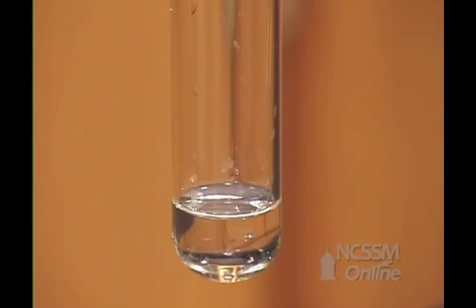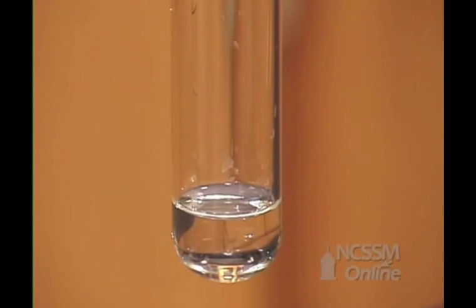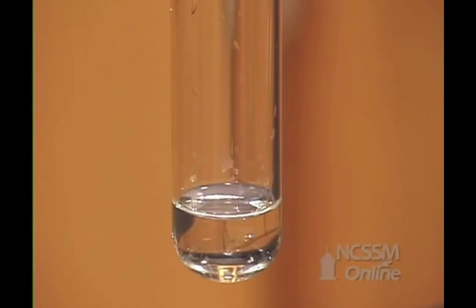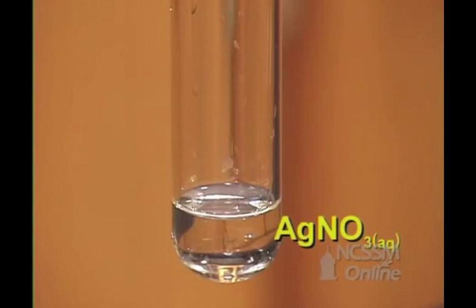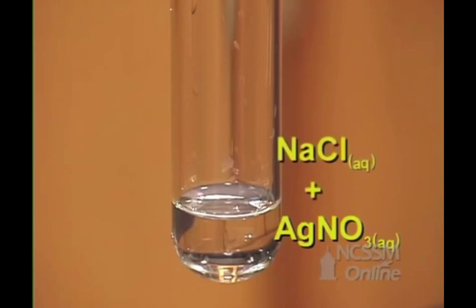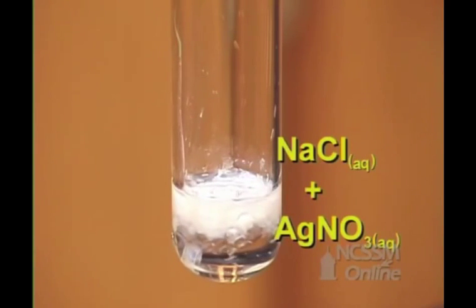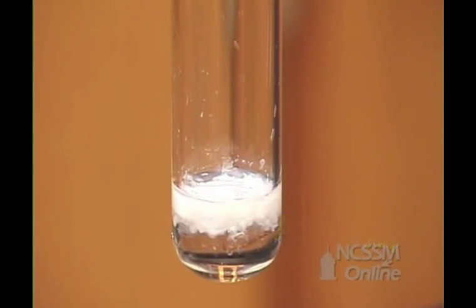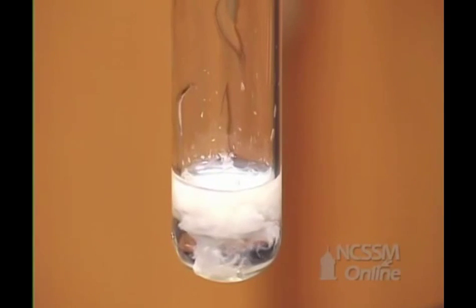In the double displacement reaction of silver nitrate and sodium chloride, we have a solution of silver nitrate, which is colorless. We will add a solution of sodium chloride, which is also colorless. When the sodium chloride solution is added to the silver nitrate solution, a white precipitate — insoluble silver chloride — is formed.